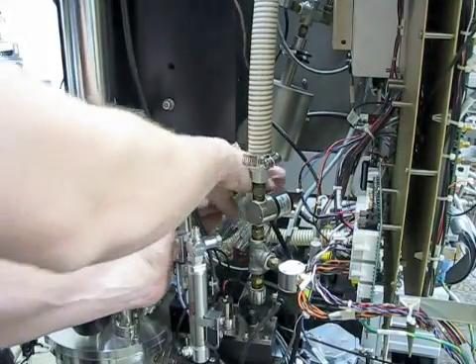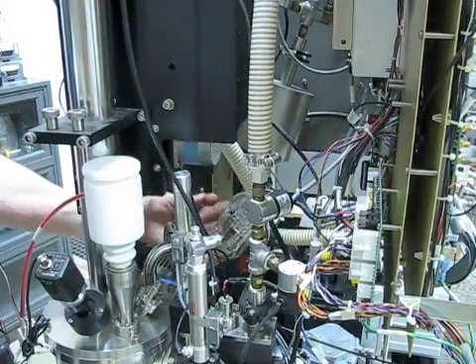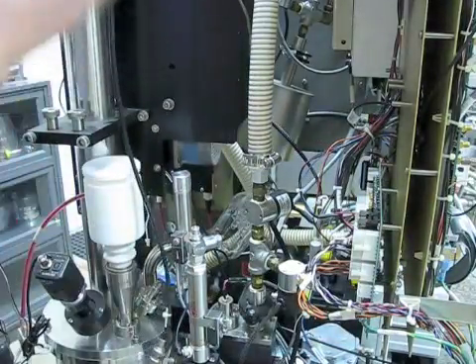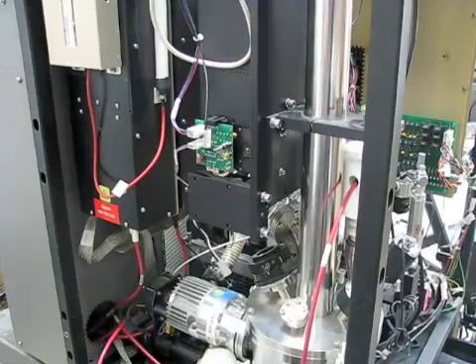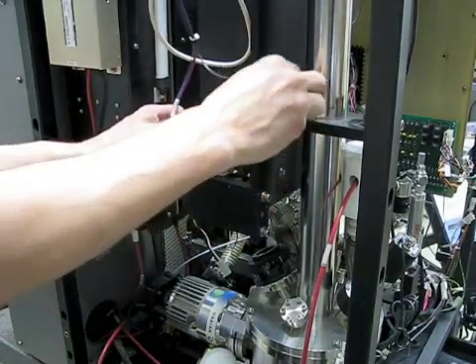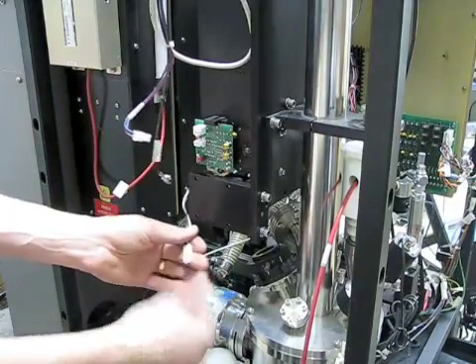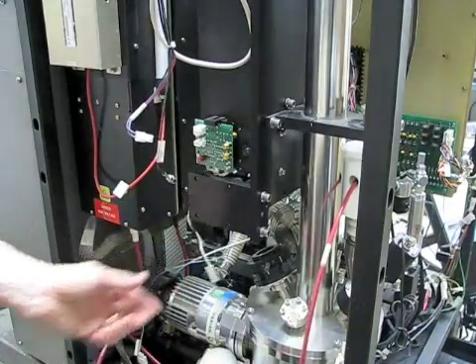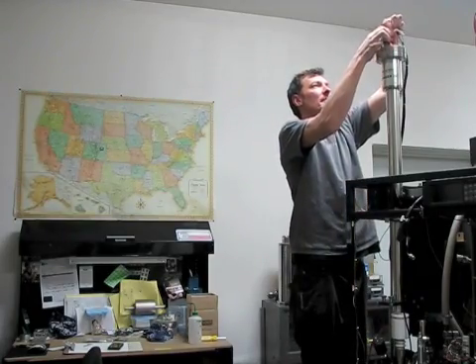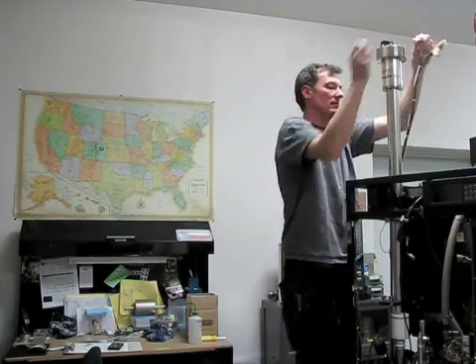To remove the power going to the stepper motor at the attenuator, be very careful. Do not grab a hold of the wires but only hold on to the plastic part. Make sure that you remove the wires from the glass ion gauge. Make sure all the wires above the hex heads are removed, including any wires attached to the opto trigger board as shown here, and the light bulb power supply. You'll also need to remove any cables attached to the detector, and make sure the power and cables going to the top part of the laser are removed.